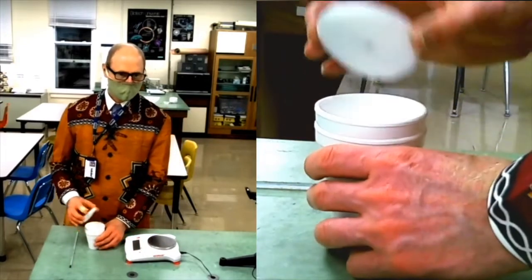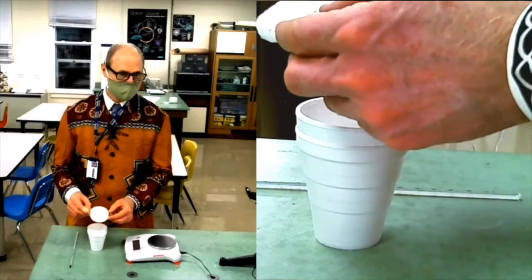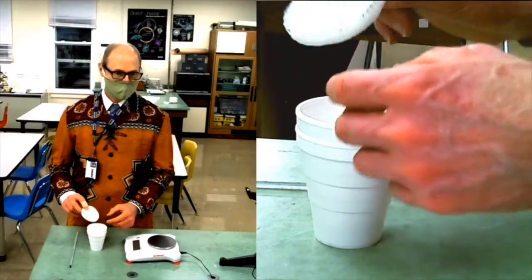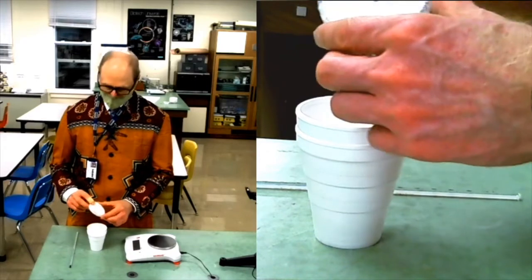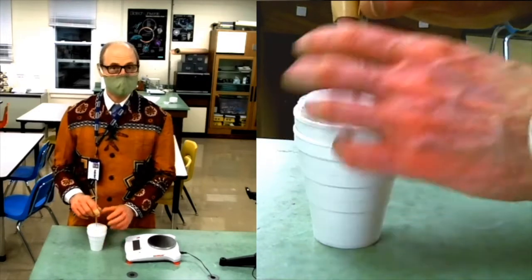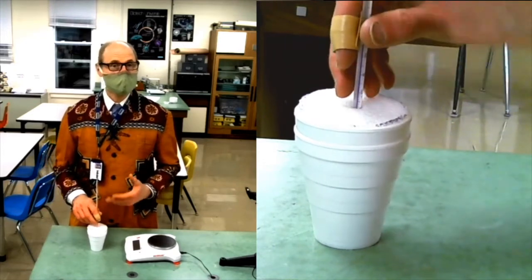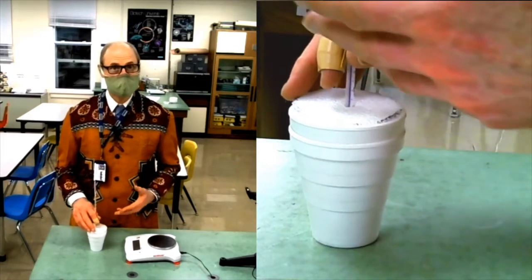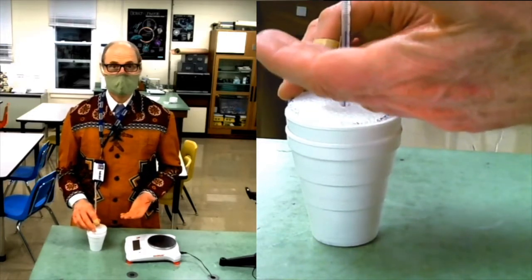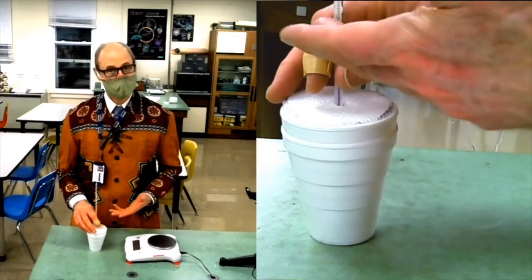This is our experimental apparatus. The calorimeter is simply made out of two styrofoam cups, and we have a piece of styrofoam that's been cut to fit the top to provide additional insulation. The slab of styrofoam in a disk has a hole in the top so that when the calorimeter is covered, we can have a thermometer inside it. We're going to measure the temperature of the water before the salt is dissolved, and then several times after, to make sure we capture the maximum temperature change — either the maximum increase or decrease, depending on whether the reaction is exothermic or endothermic.